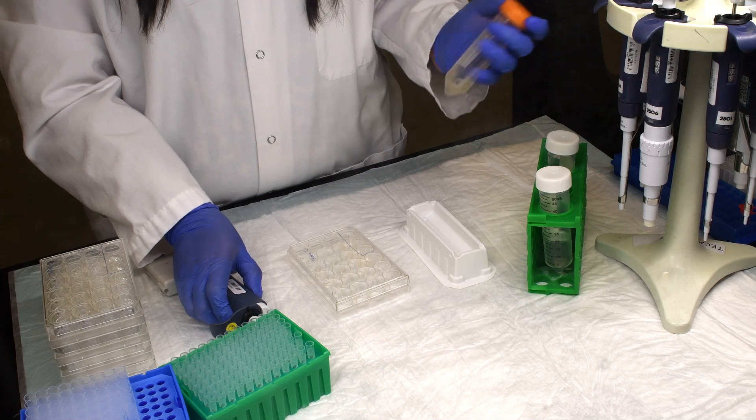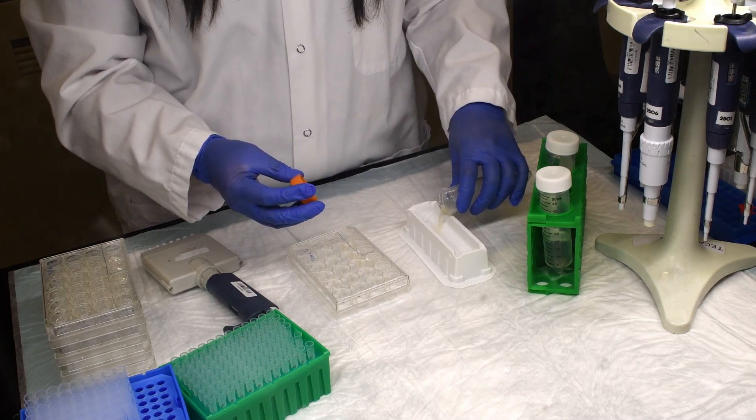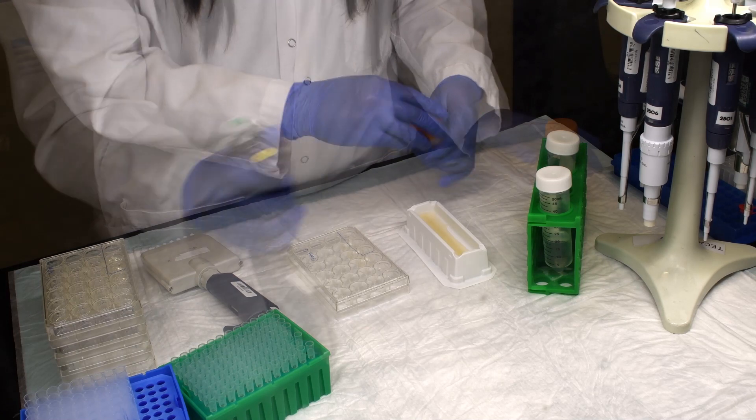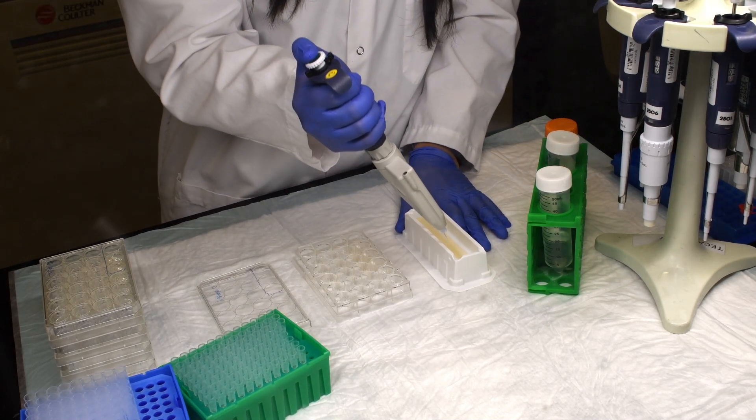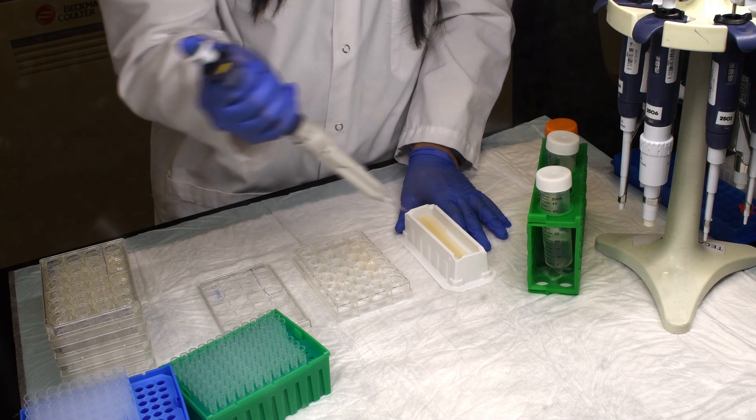Once the cells are thawed and the plates are prepared, the incubation can be started. With the cells in a cell reservoir and a multi-channel micropipet, load 100 microliters of diluted cells into each well containing medium with test compound or with the vehicle controls.